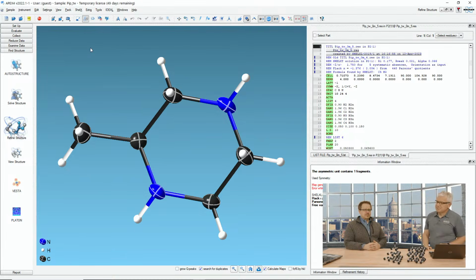Often people, including myself, when we have bad quality crystals and they're just split, we will call them twins. But technically, they're not twins because it might be just a 5-degree rotation. So it's just an imperfect twin, or imperfect crystal.